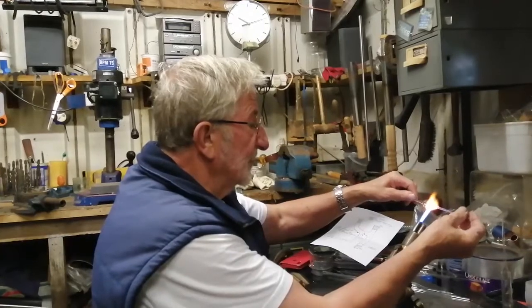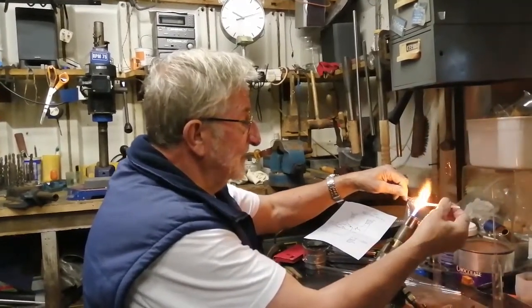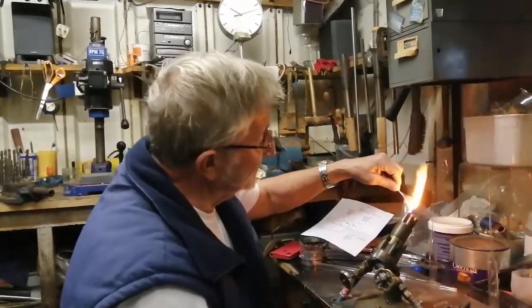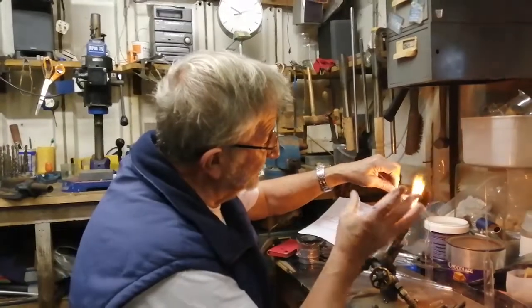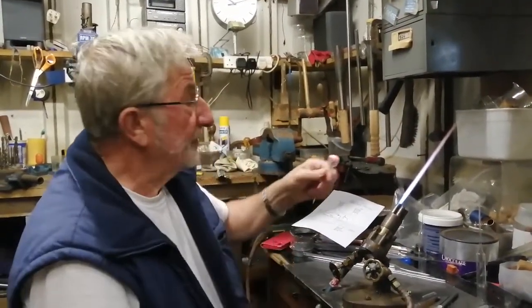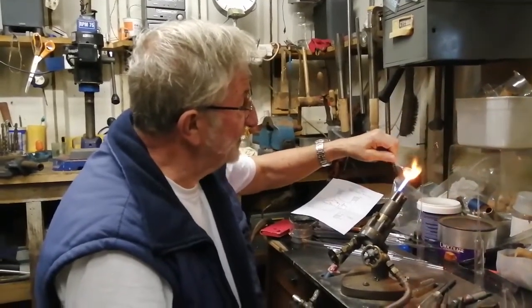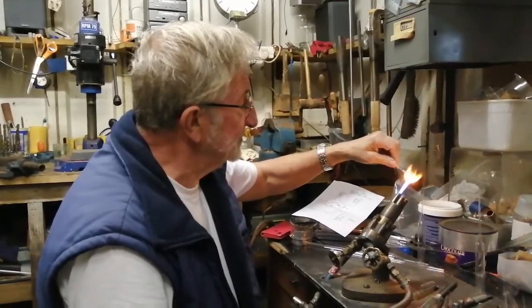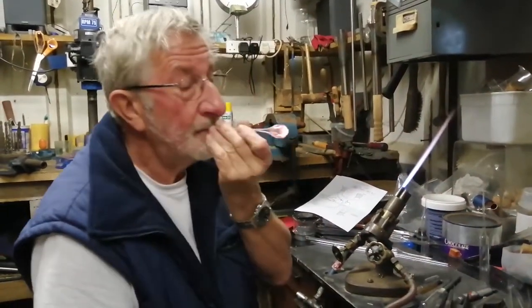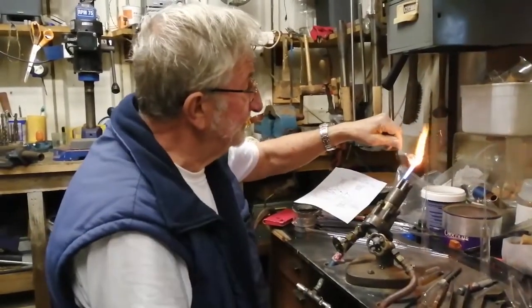So what Carolyn will be doing, we'll be copying what I'm doing now. So we've got a point here on the right hand side. Just gently pull that away. Notice how the glass starts to melt, starts to gather back. A wee little puff. The trick in glass blowing is knowing where to put the flame and the glass. So the glass here is in the flame, just behind the domed end.